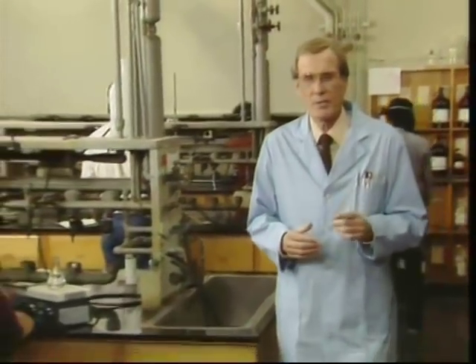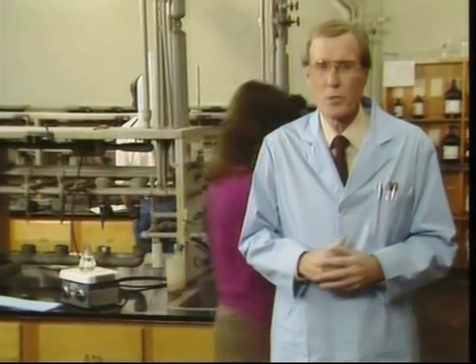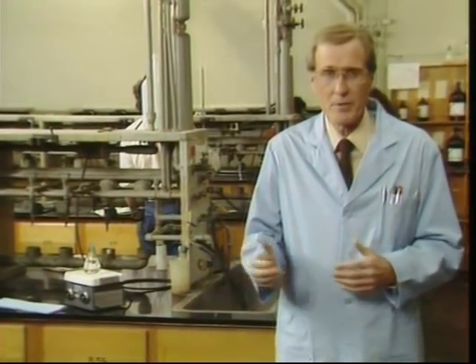Everything you do has an effect on the people around you. Try to think of a lab as a community. As you've just seen, the actions of the people around you can have a serious effect on you. But if you remember to think prevention, you'll remember to protect yourself, and thereby the others in the lab.